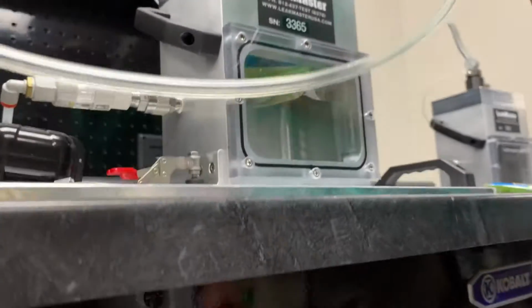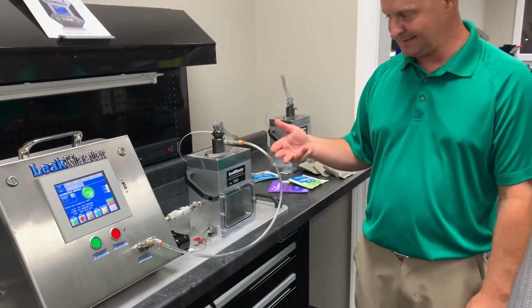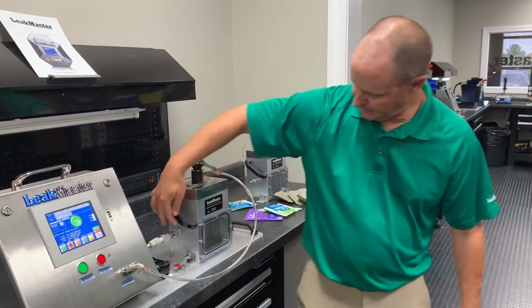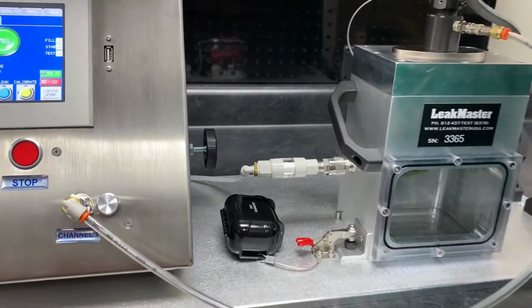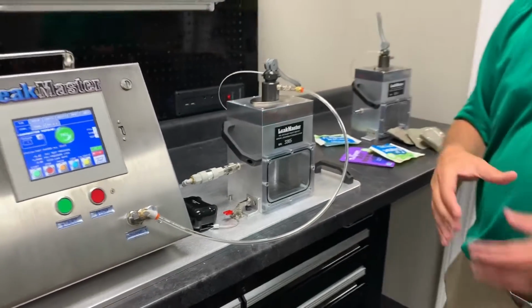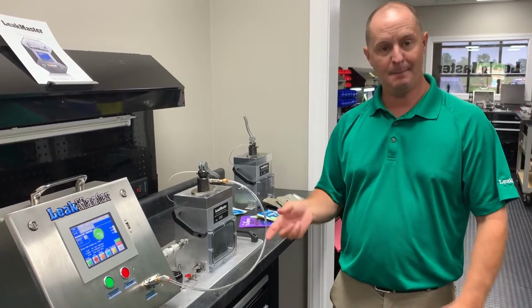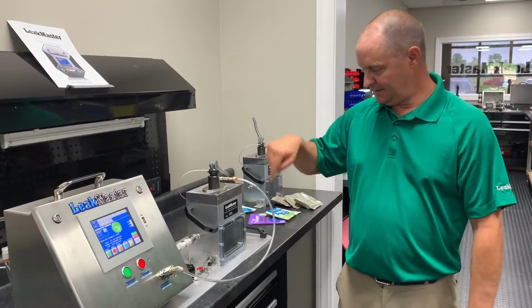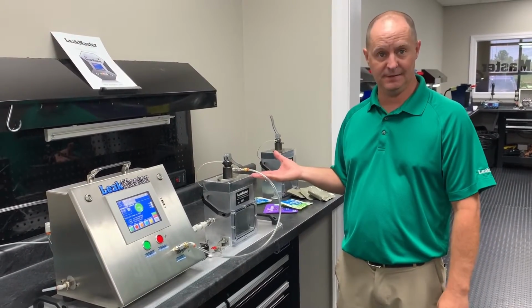If it maintains a minimum set point pressure, then it's not a gross leak. And then it'll continue to the test step. If the product is leaking any air, it's going to leak inside this chamber, and then we've got a separate test line here that returns back into the tester, which actually returns into another pneumatic manifold with a valve and mass flow sensor. So that mass flow sensor is going to measure any air that's being put into this chamber, and that is representative to the size of the leak of the product.